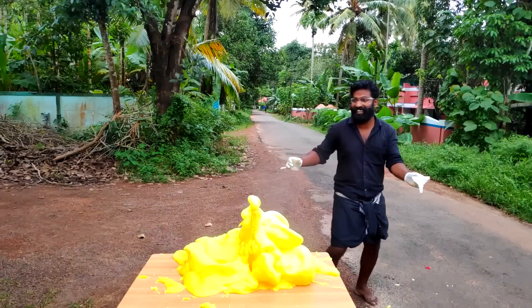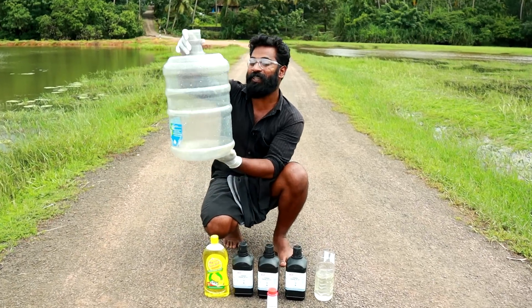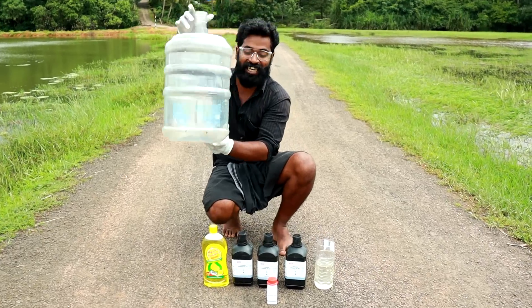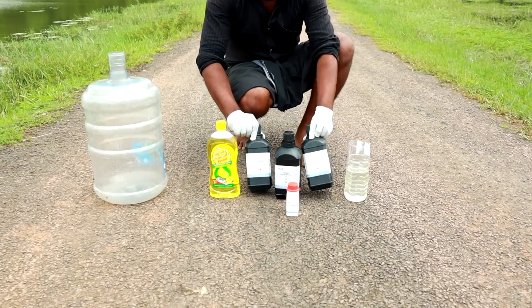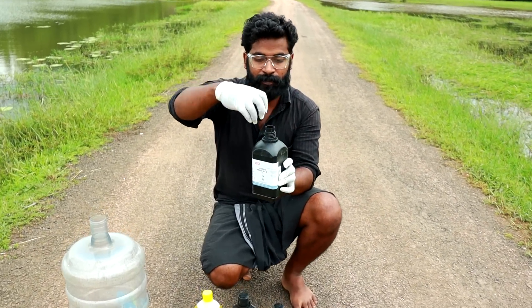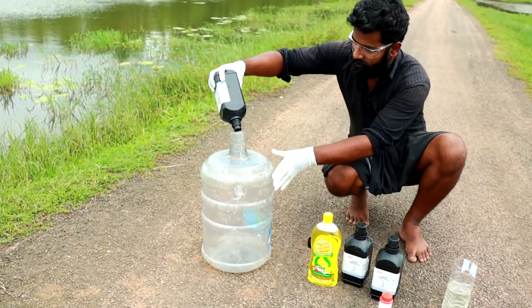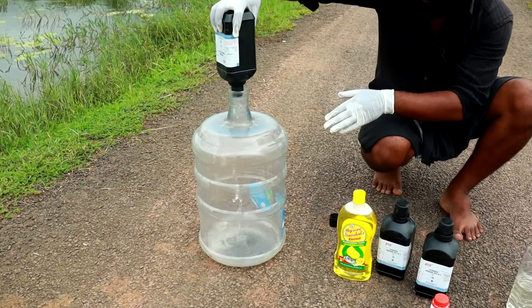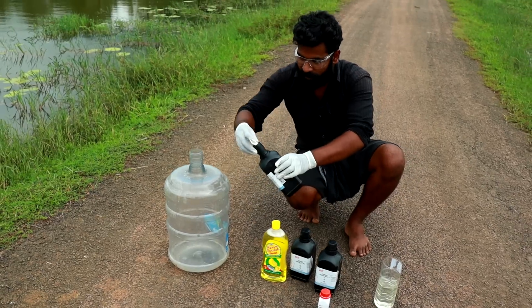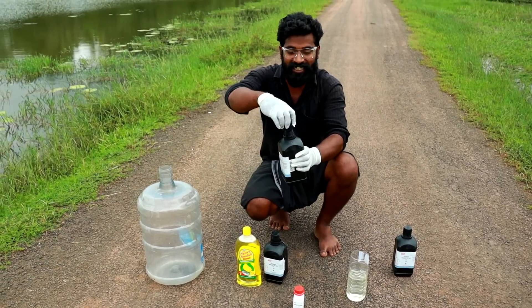Now let's do a big demo. Friends, we will do a big demo in this jar. We have H2O2 — hydrogen peroxide — a little bit of H2O2, 30% concentration. I feel it. It's 30%.